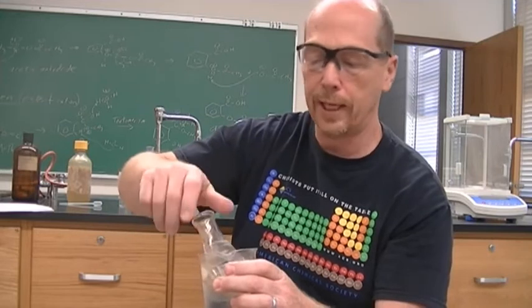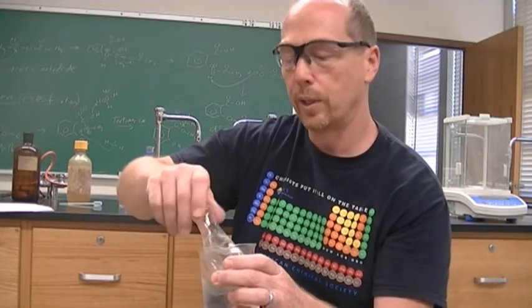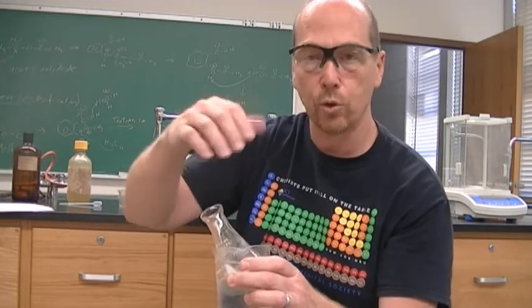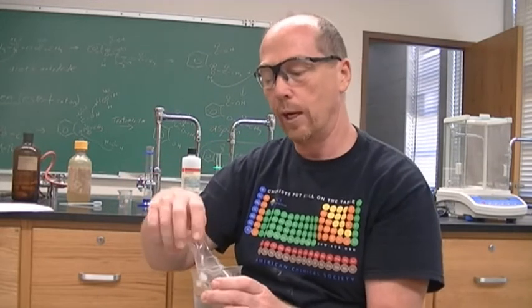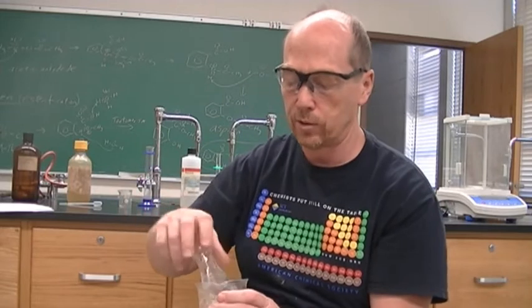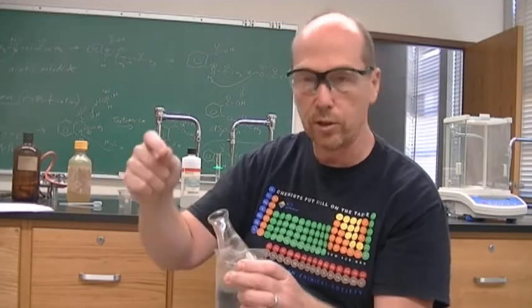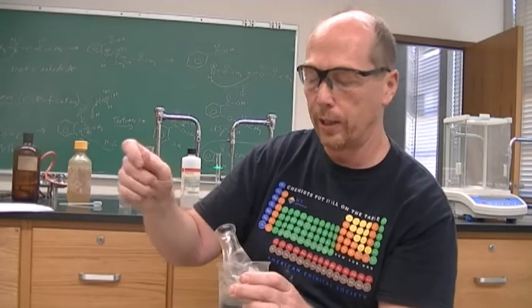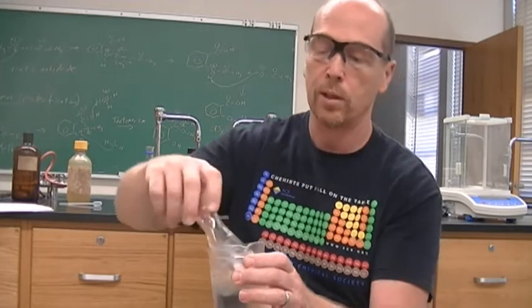You can keep heating it. You can then cool it, and heat it and cool it again. The reason is that you could have too much solvent in there, so it's not going to precipitate out. As you heat it, you are evaporating the solvent, making it more concentrated, so that when you cool it, it will precipitate out. Scratching it gives the crystals a surface to form on, so you get a stirring rod and scratch the bottom of the glass to give the crystals a place to crystallize.